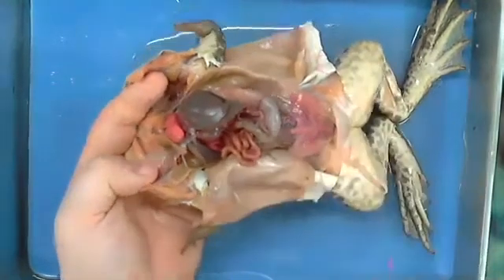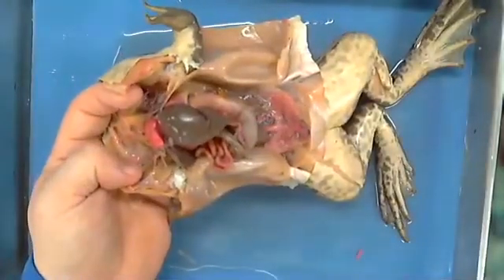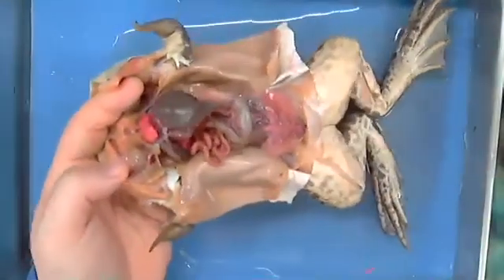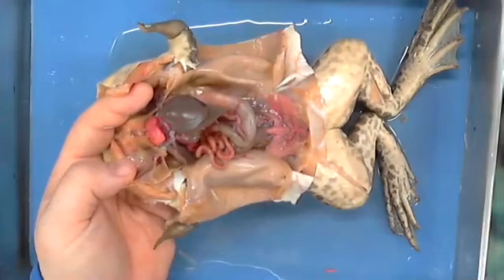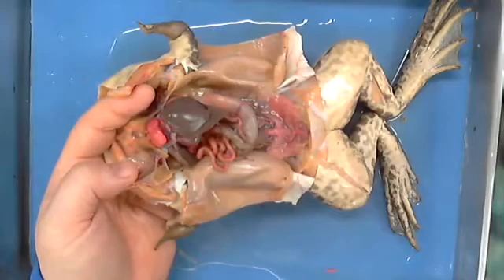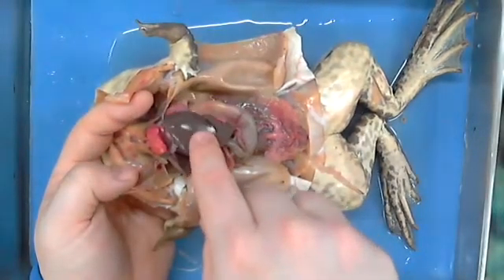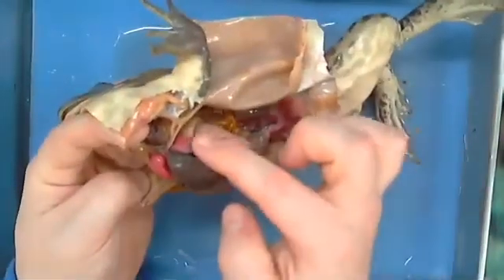All right, on this side over here, and by the way, the pink stuff that you see, why are some things pinker than other things? Think real quick about what I talked about with this frog for me. Blood flow. The pinker something is, the more there's blood flow. So you wouldn't expect to see a whole bunch of that here in this liver. But notice, if you will, on the side of this liver, you see something.